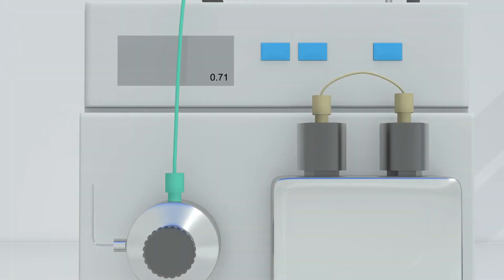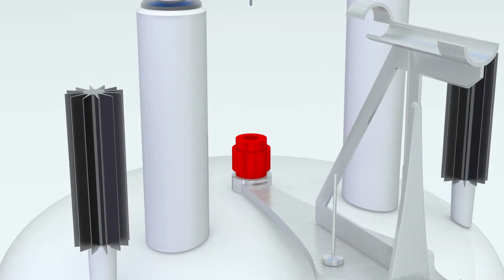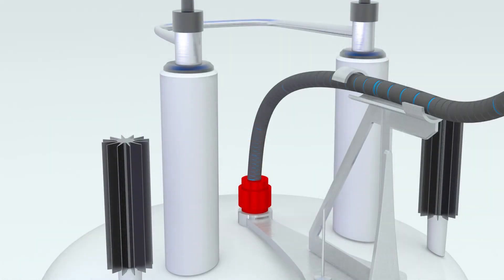Firstly switch the pump OFF. Then remove the glass flow tube protector if it is still ON and clear any condensation that may have formed. Then carefully insert the Insight MR flow tube assembly into the magnet and push it completely down. To ensure proper insertion, lift it up by about a centimeter and then push it back down again. You must feel a solid resistance and hear a click.